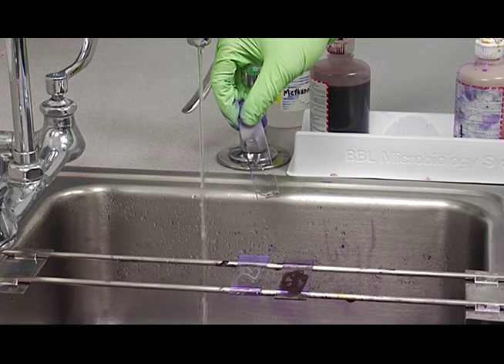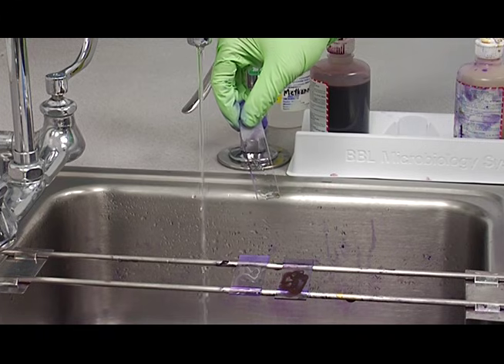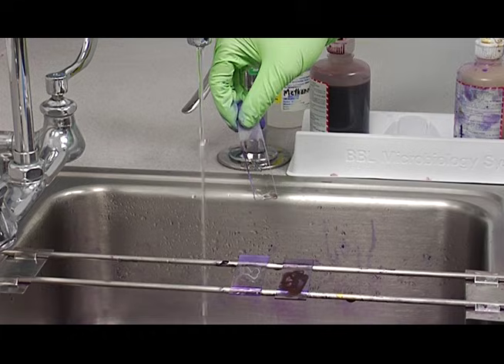and as you see the blue stop flowing out of the smear, you rinse it off right away at that point. You want to keep the decolorizer continuously flowing over the smear until that point.